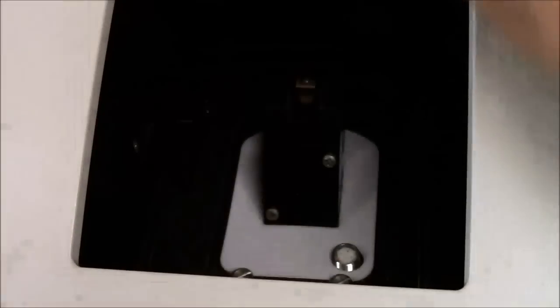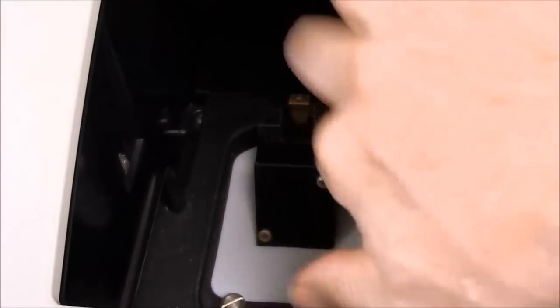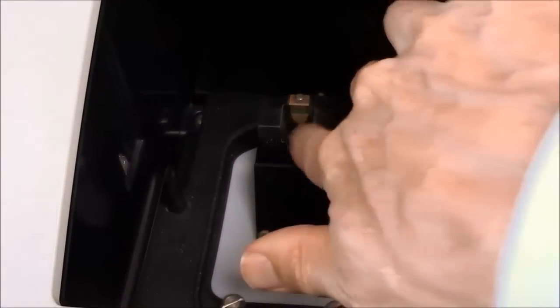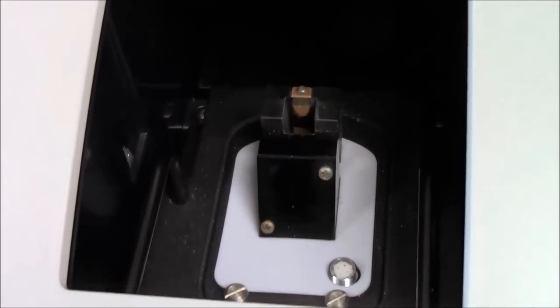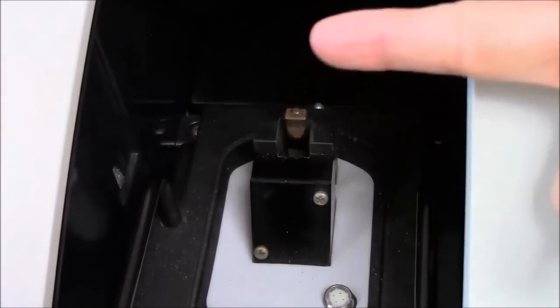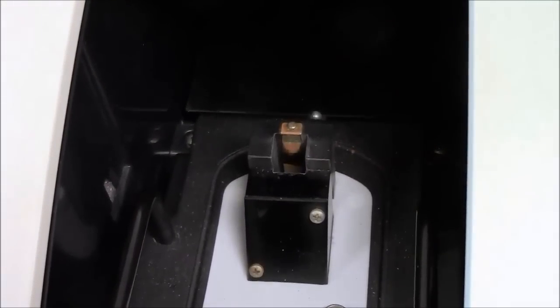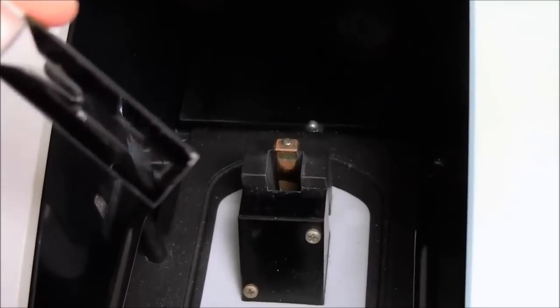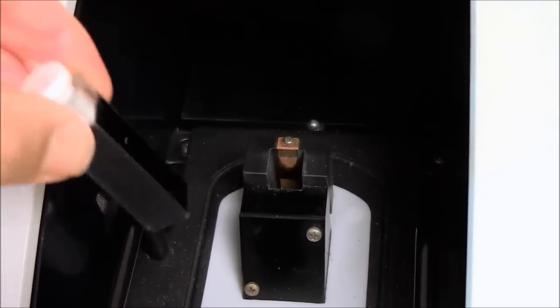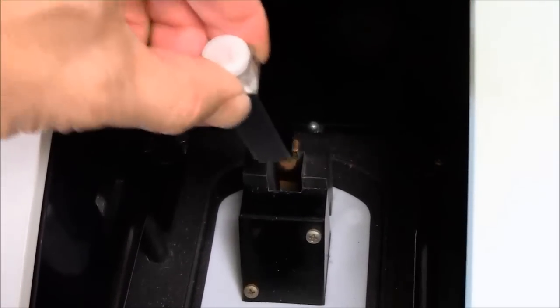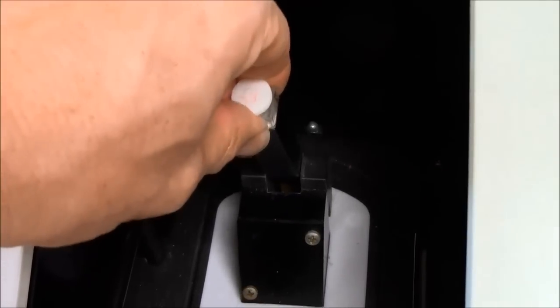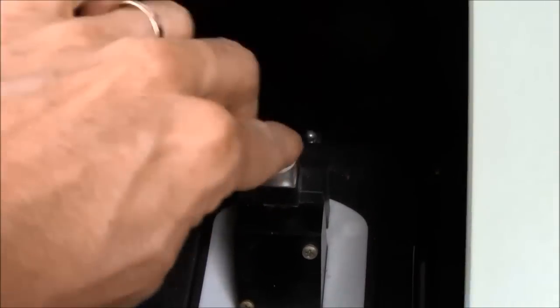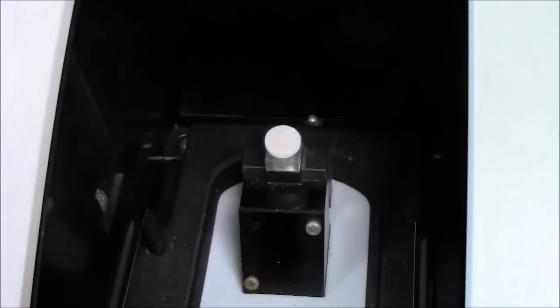I'm opening the hatch on the spectrophotometer. Inside there is a cuvette holder here. The light beam travels in this direction. So I need the clear faces of the cuvette, clear faces of the cuvette pointed in this direction. I push it all the way to the bottom.